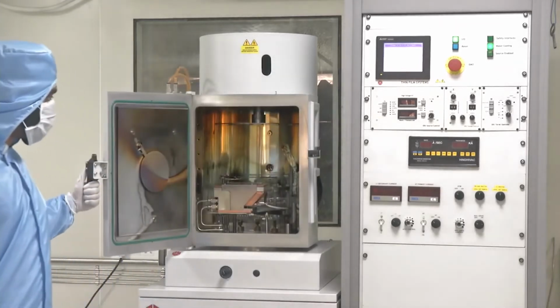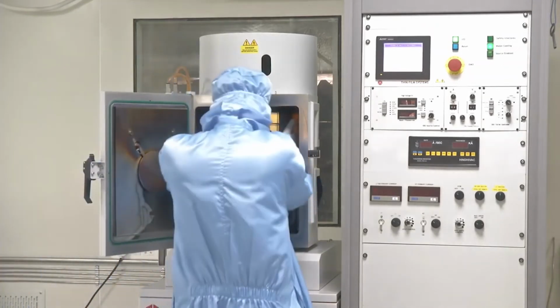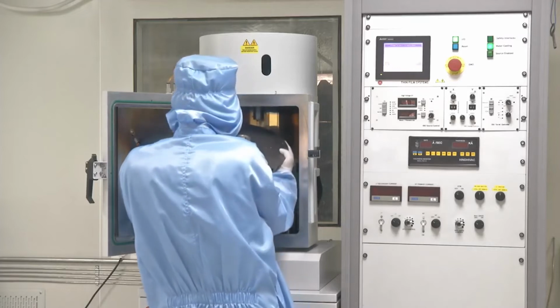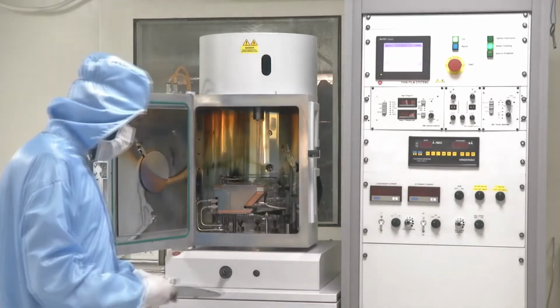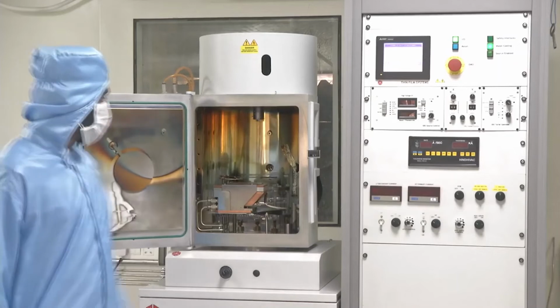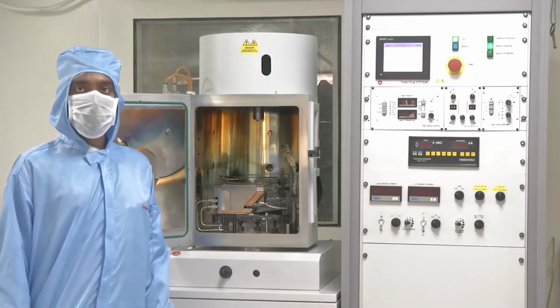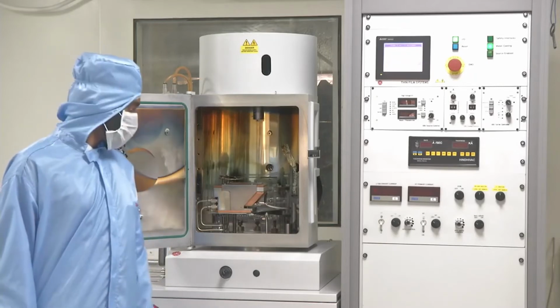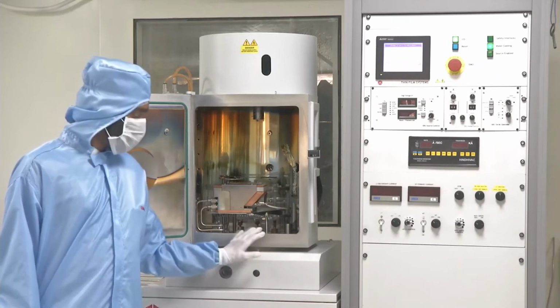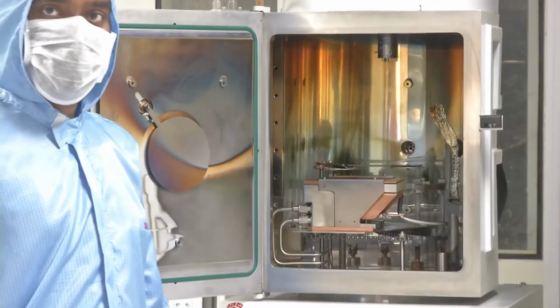After opening the chamber, the next step is to unload the chuck. Chuck is another name for the substrate holder. The substrate here can be a silicon wafer or glass wafer or any other kind of substrate, such as glass slides, on which we would like to deposit the material. Now that we have taken the chuck out for loading the samples, before we load the chuck back into the chamber, let us look in detail at what is inside an electron beam evaporator vacuum chamber.